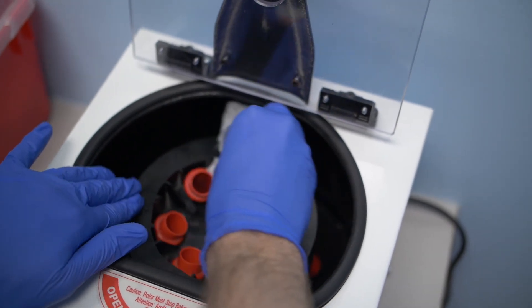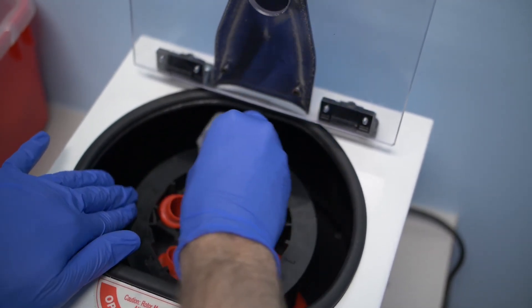To keep it clean and running smoothly, lightly clean the rotor and wipe down the centrifuge at the end of each use. When you're finished, leave the lid open so that it can air out and remain dry.